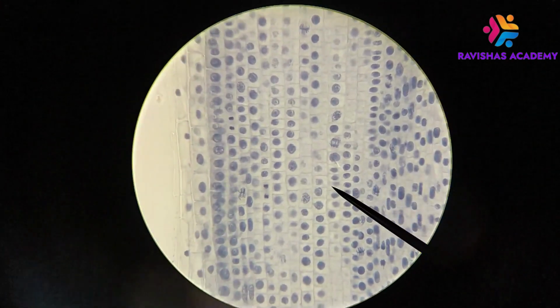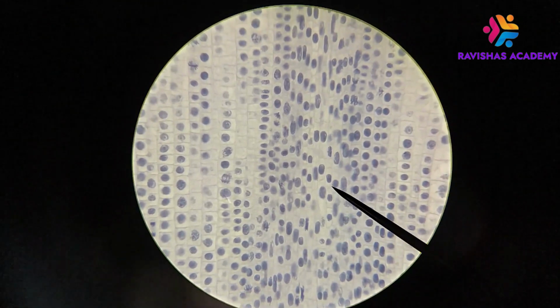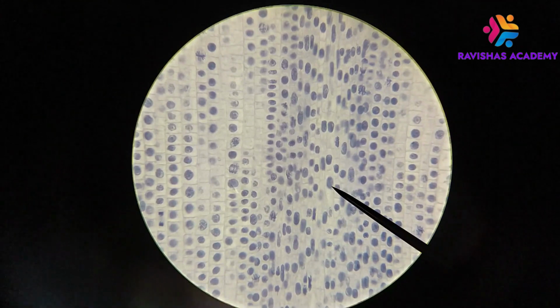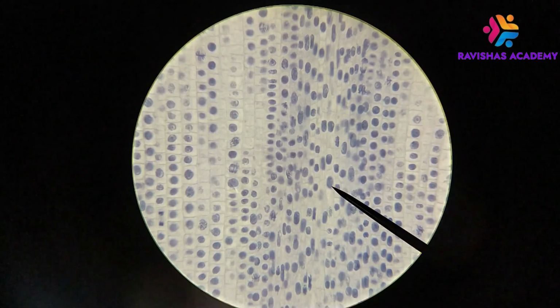Okay, so what we see on here is a variety of different cells doing different things. Now right now in the middle here, for example, the cell at the pointer right now is a cell that is at interphase. So recall from your slides and from your lecture that cells have different parts of their cell cycle. You have the M phase, which is usually mitosis, sometimes it's meiosis, and you have the interphase, kind of the stage in between the division.